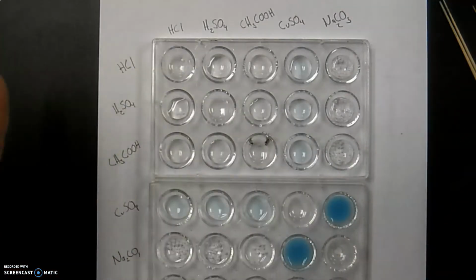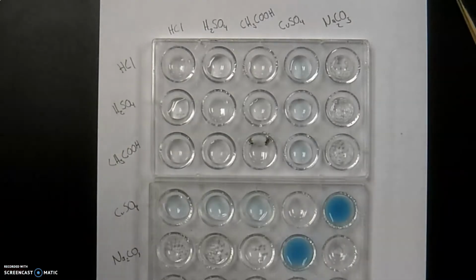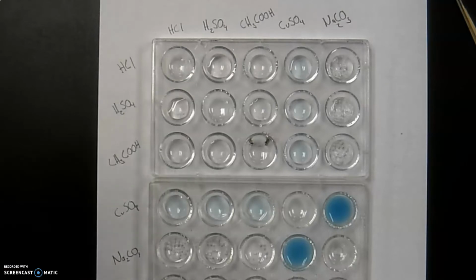All right, so we've got this kind of established as far as who's making a reaction and who's not making a reaction. Now we have to move over to the last part, which is the most important, is kind of laying out what are these reactions. So for this part, I'm going to show you over on the board some of the ways I need you to go through and tell me, what is the chemical reaction taking place.